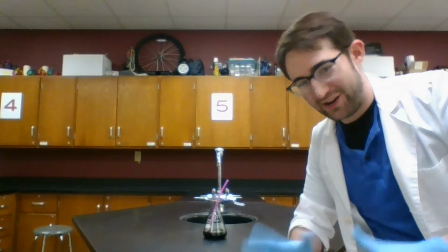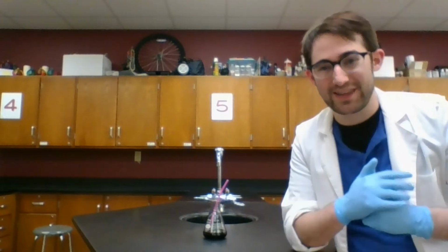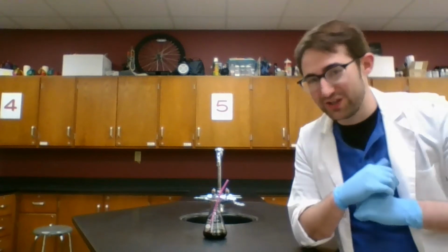I'm going to break a rule of lab for this one. I'm going to break a fundamental rule. You should never eat or taste anything in the science lab unless you're specifically told you can taste or touch or eat this specific thing. And in general, you should never put your mouth on something that a chemical is on the other side of, like a pipette or anything like that. Now, I'm going to do just that.